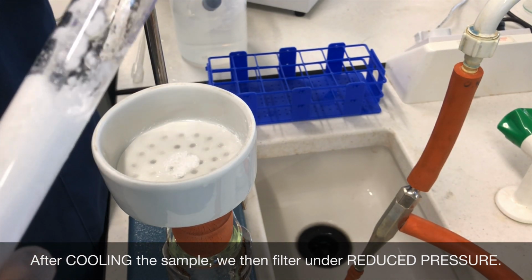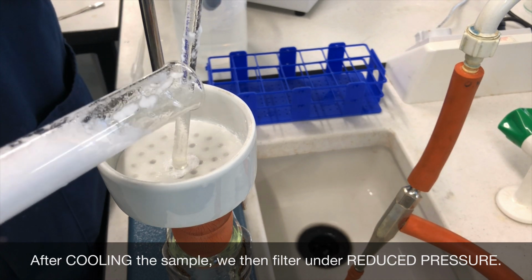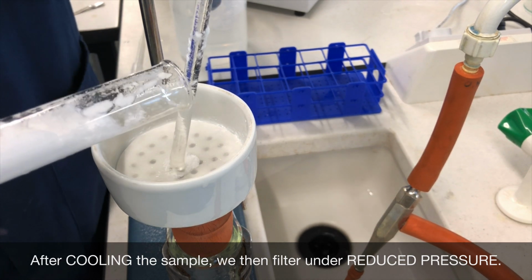You may also be asked to suggest the specific equipment. So for instance here, we're using a Buchner funnel and a Buchner flask.